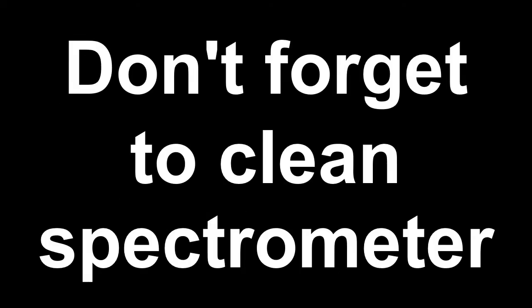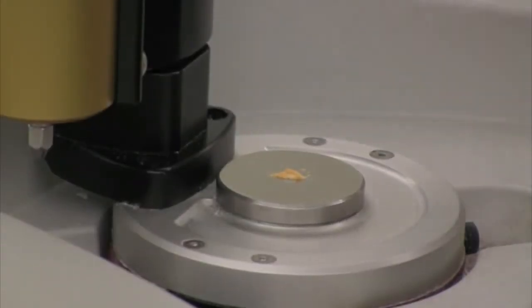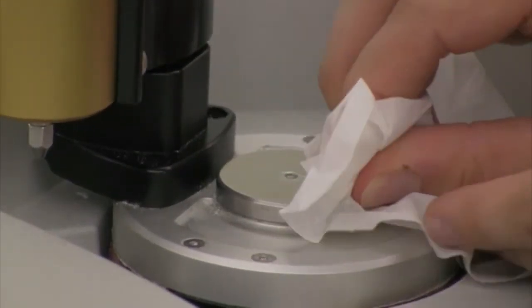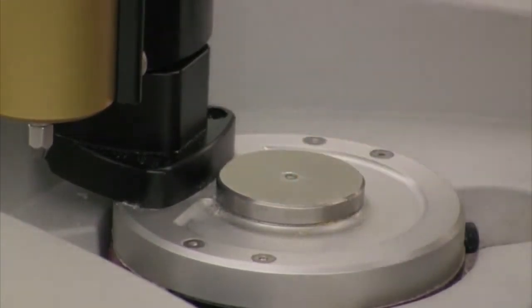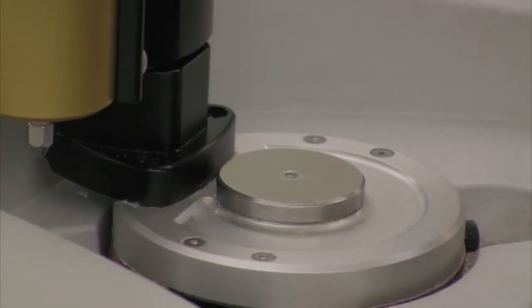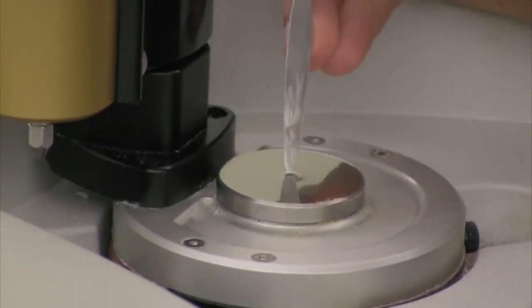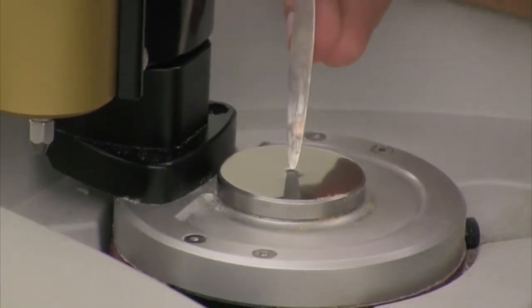Then the last thing you have to do before you leave is clean your sample off of the diamond. So the easiest way to clean your sample off the diamond is to simply take a Kimwipe and wipe your sample off the diamond. That's easier to do with liquids than solids. If you have a solid and that solid was pressed up hard against the surface of the diamond, you might want to use a microspatula, kind of like an ice scraper blade on a windshield, to scrape the material off the surface of the diamond.